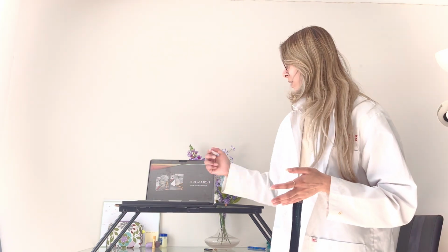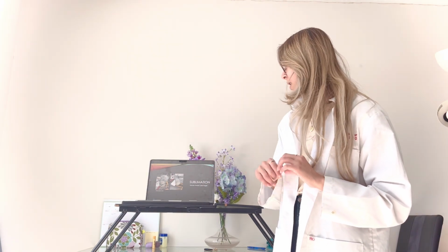Sublimation in the lab looks like this here. We used a cold finger to do it. It was a homemade cold finger that was provided by Dr. Latmeyer, and as we can see, we're using it there.